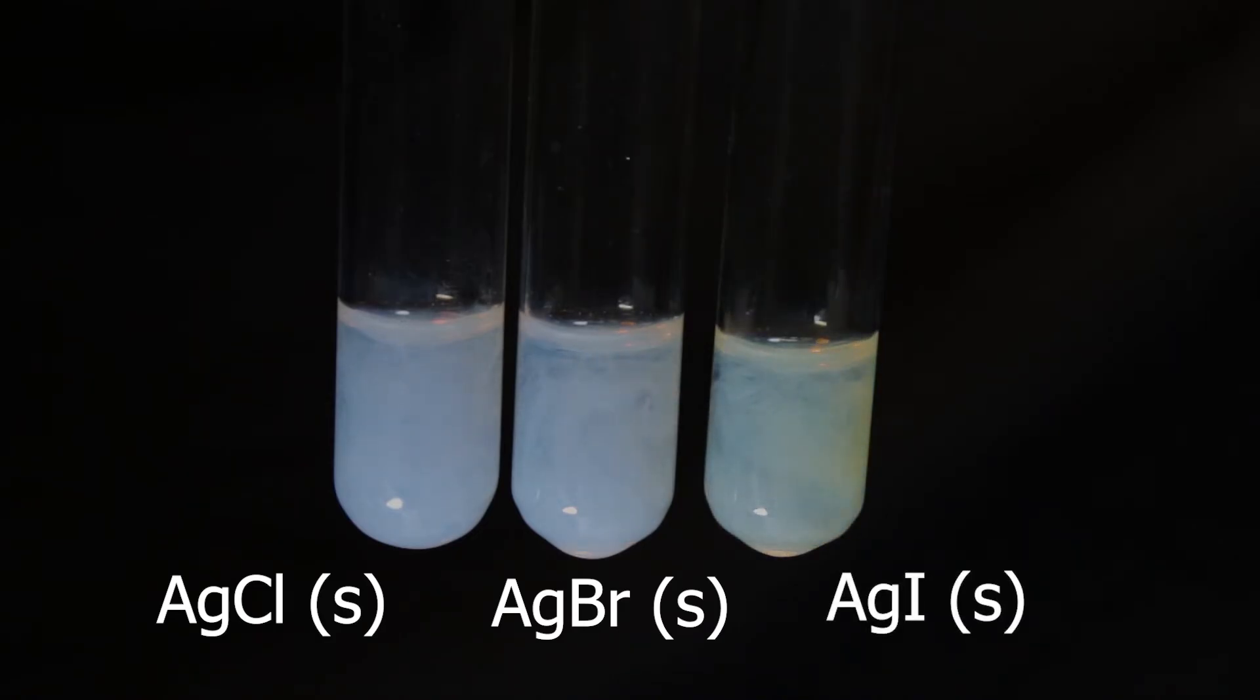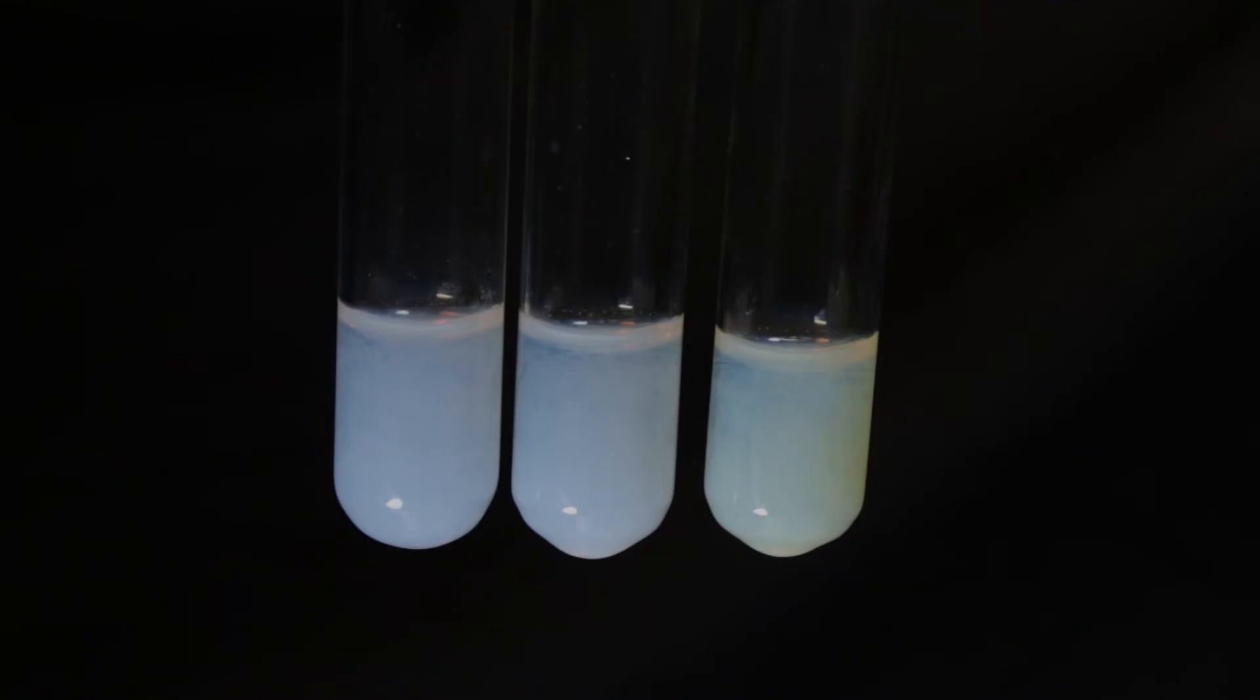Which one is cream, which one is really white, which one is yellow, it's not so easy to tell. It depends on lighting and on concentration.